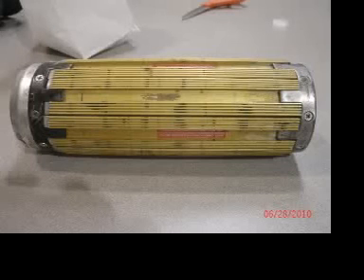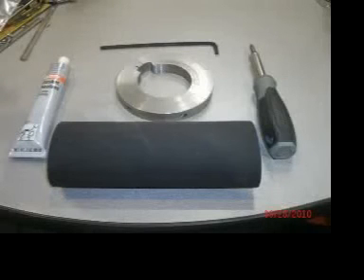This is a JRC core holder, and if you're somebody who's lucky enough to have to replace a bladder on one, it's not an easy thing to do, but stick with me, you'll get it done. These are the tools you will need to do the job.